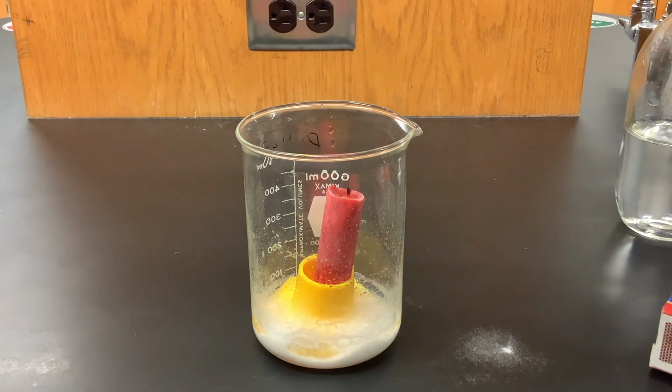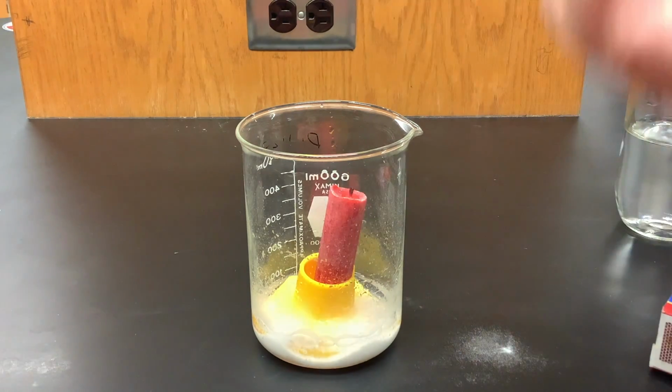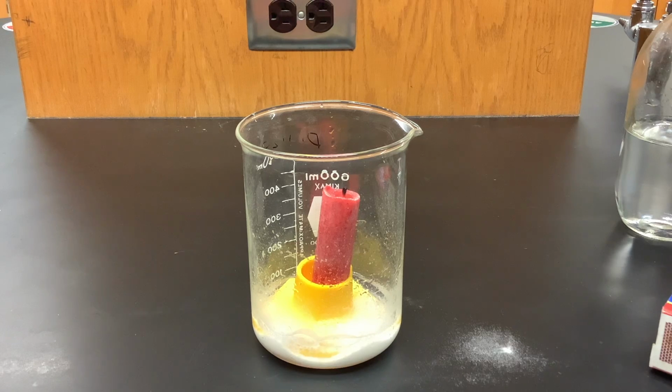So we have air that is on top of the beaker. We're comparing whether the carbon dioxide is heavier or lighter than air. If it were lighter, it would escape outside of the beaker, and we would replace carbon dioxide with air, which contains nitrogen, oxygen, and carbon dioxide. Oxygen, we know, supports combustion. So if the carbon dioxide stays in the beaker, if it's heavier than air, that means that we should not be able to relight the candle. I was unable to relight the candle even minutes after the reaction stopped. So that suggests to me that the carbon dioxide is staying inside of that beaker. It cannot escape because it is heavier than air.